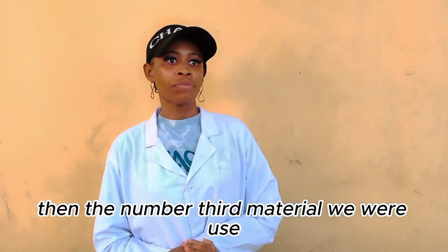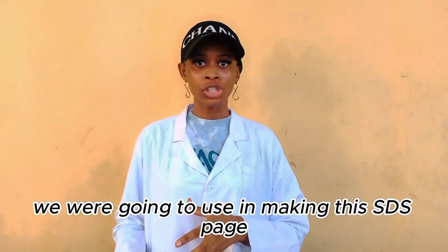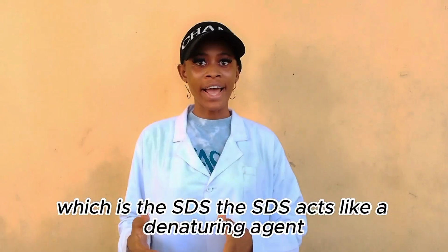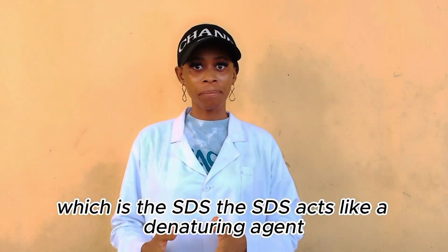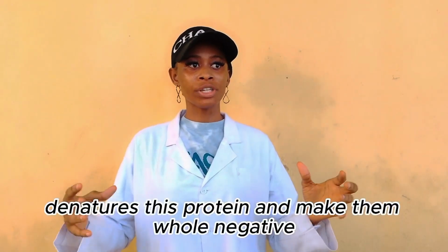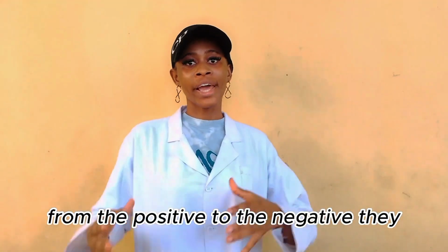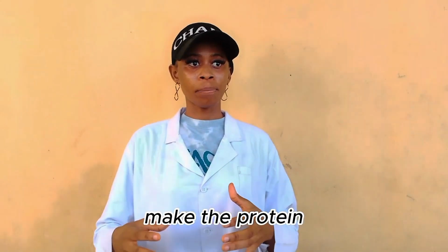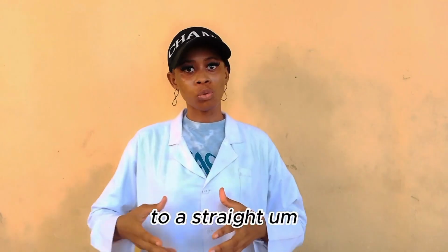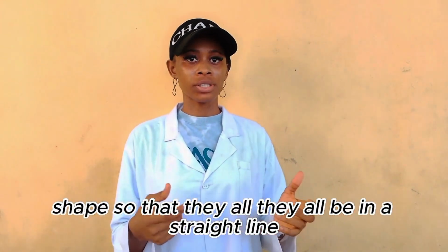Then the third material we are going to use in making this SDS page is the sodium dodecyl sulfate, which is the SDS. The SDS acts like a denaturing agent. It denatures the protein and makes them all negative. It makes the proteins lose their shape from the bent shape to a straight shape, so that they'll all be in a straight line.